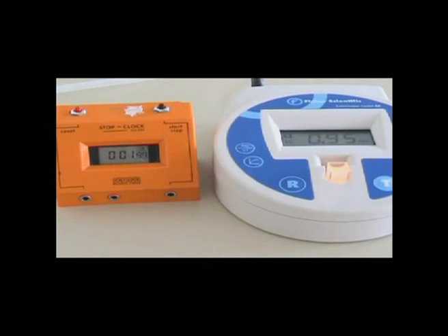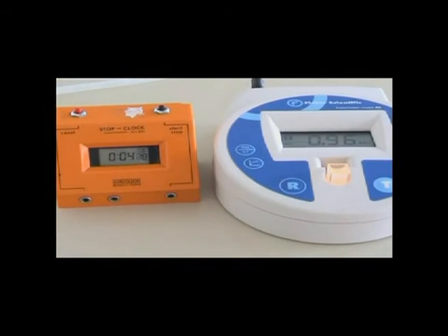2% protease enzyme solution. Notice that the protease enzyme solutions have not been put together in order. You need to do that. This time the starting reading is 0.93.